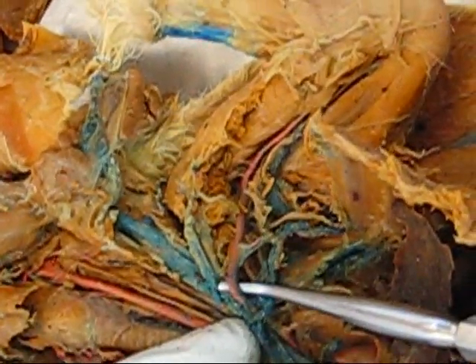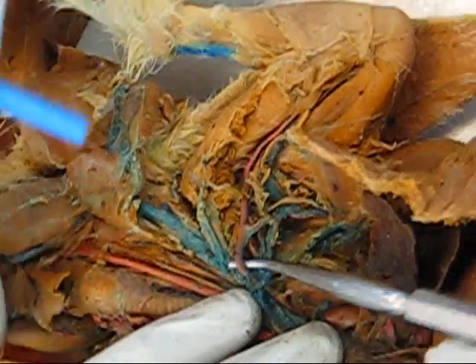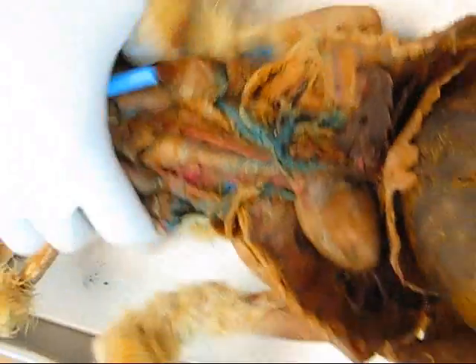Right and left internal thoracic artery — we'll use another rabbit for this.